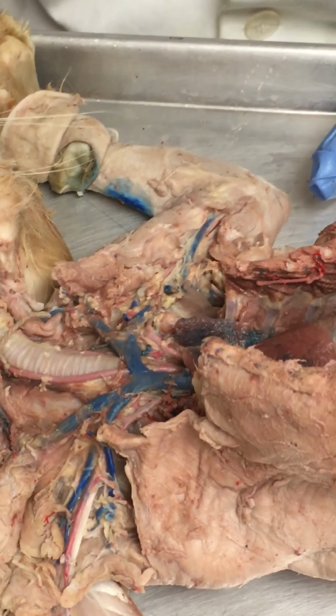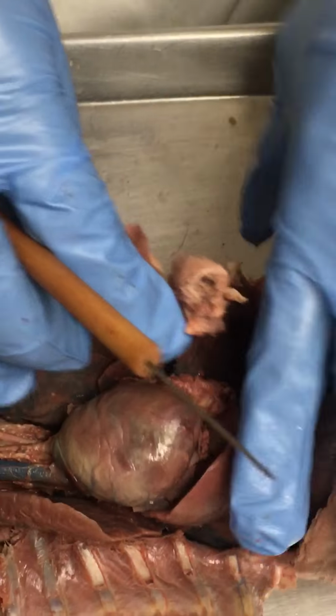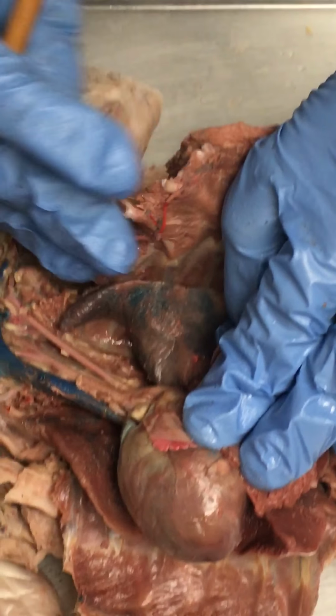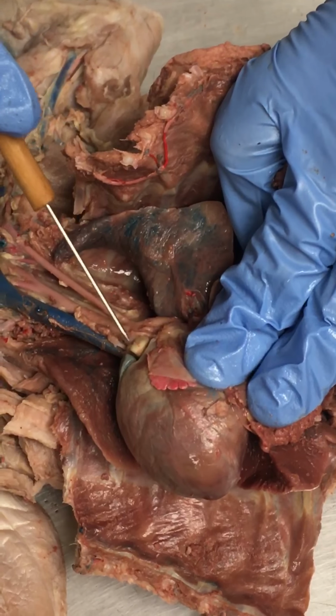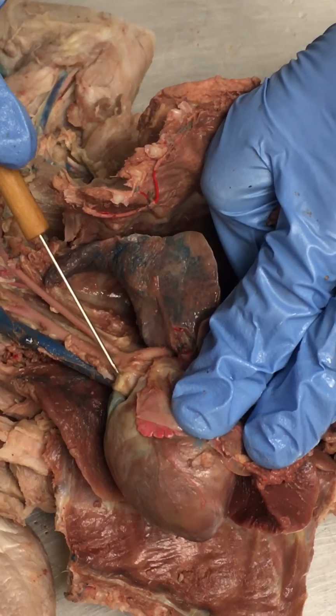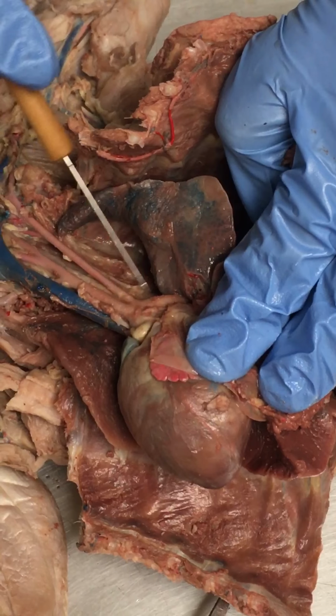Okay, so let's go through the arterial system. So aortic arch, this will be a little bit difficult to see for everybody because of the lighting in here and the contortion of the kitty cat I have to do. But you can see this is the aortic arch. There's a little bit of fat right there that we could remove, but it goes out of the left ventricle and turns and goes down. So that structure is the aortic arch.